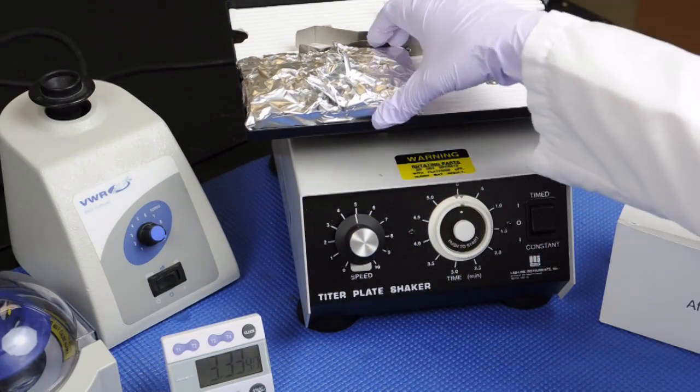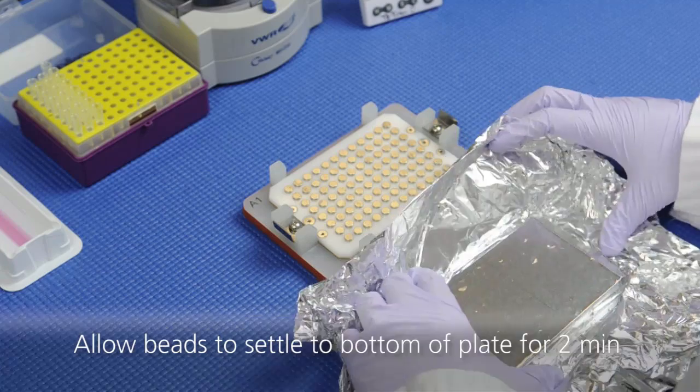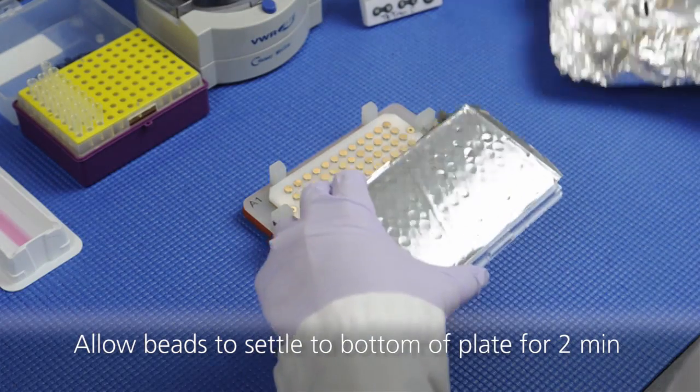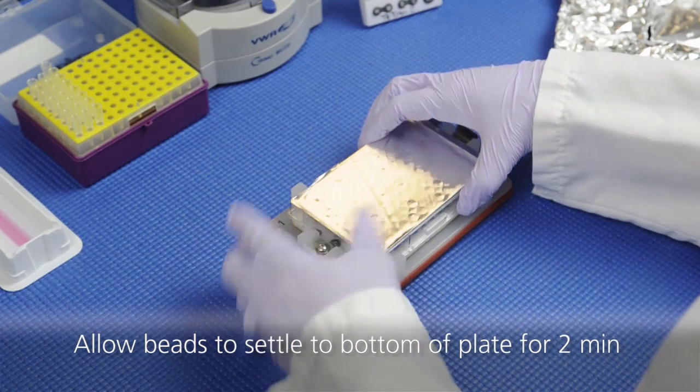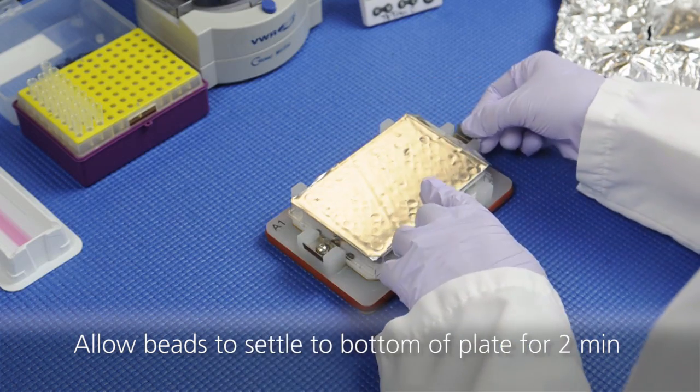After incubation, remove the plate from the microtiter shaker and place the plate back into the handheld magnet. Allow the beads to accumulate on the bottom of the well for two minutes.